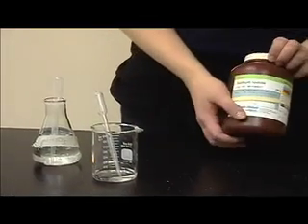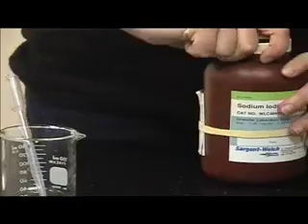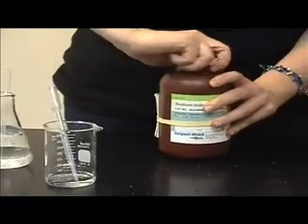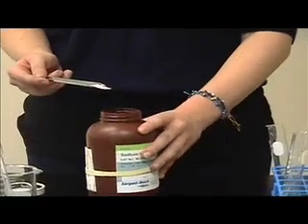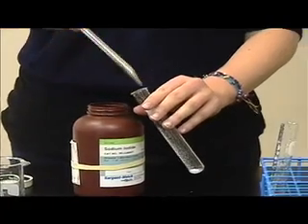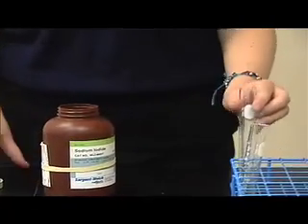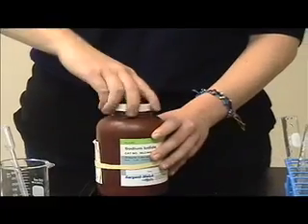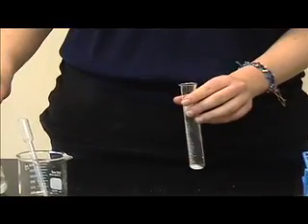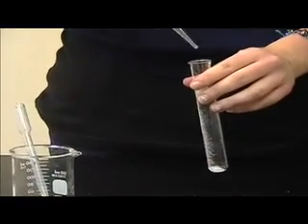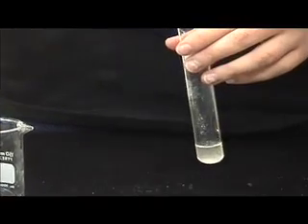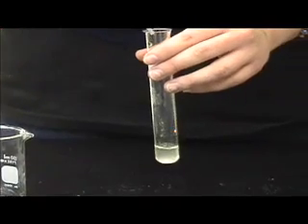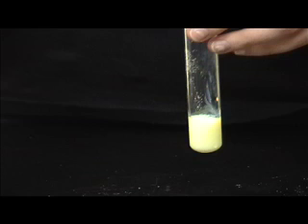So we're going to be doing iodide now, and again you'll want to open the cap, and using a clean scoopula, put some into a test tube. And we will be adding dilute nitric acid and silver nitrate. And it should be forming a yellow precipitate. So we'll take the test tube, and we'll add the nitric acid, and then the silver nitrate. And it should form a yellow precipitate, and I will put the equation below. So there's our yellow precipitate, and here's the equation.